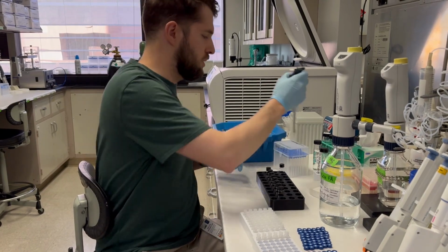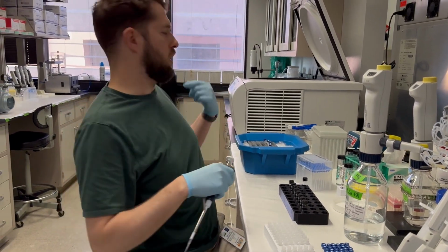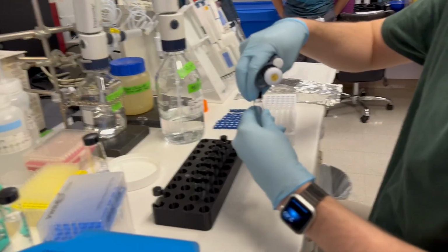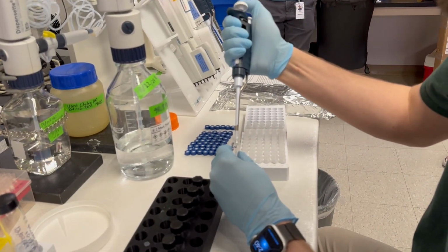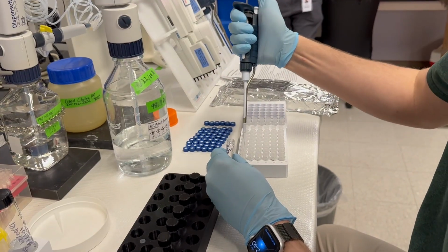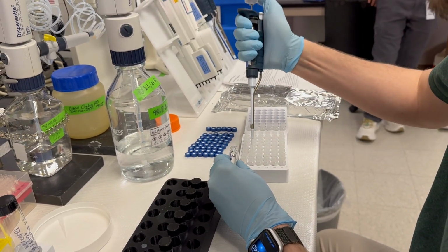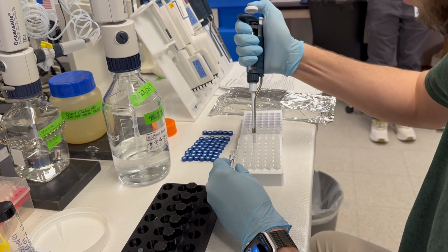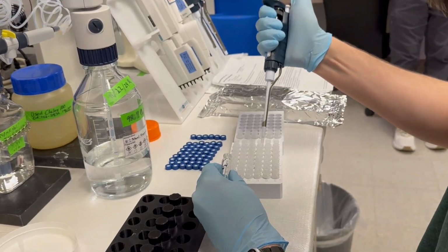Okay, we'll get a new tip. And if you come around the other way, maybe that would be a good angle, or no? The other way was working fine, but okay. This also works. Yeah. And again, I'm just counting in my head to keep track of where I am.